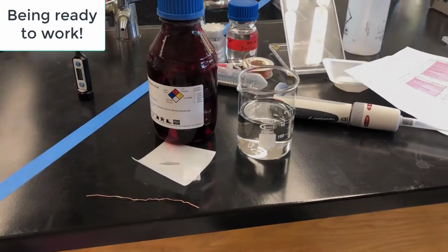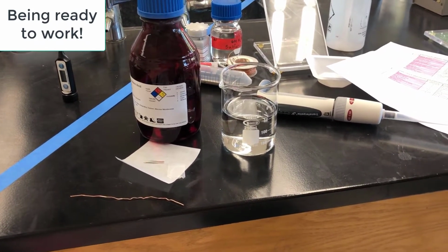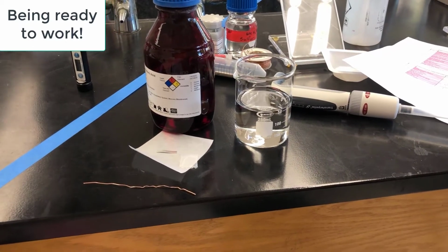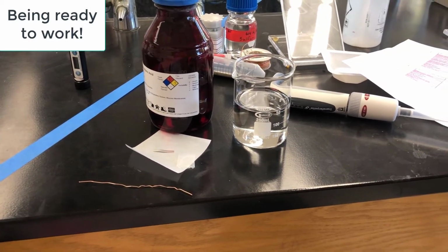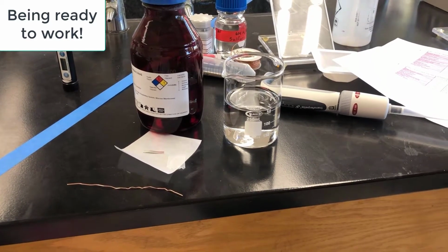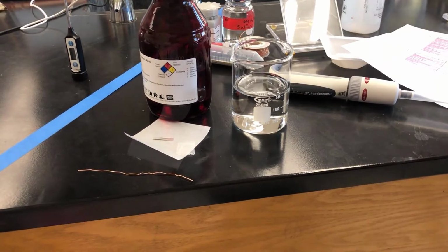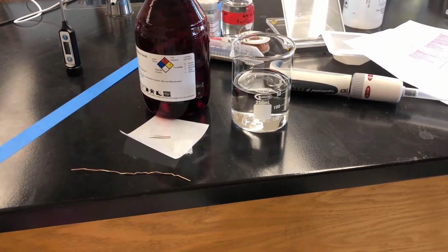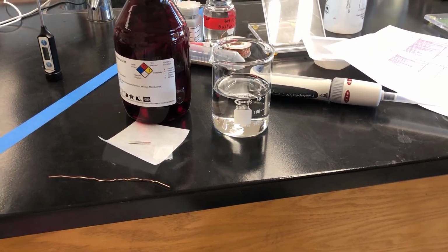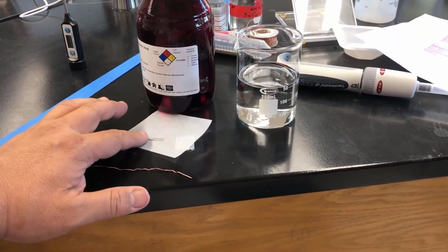I have all the things laid out for what I'll be doing in this next step, and I thought I'd just say something about this. If you want to be efficient in a laboratory or any workspace really, it's important to read the instructions of what you're doing and make sure that you have everything prepared ahead of time. I am actually modifying the procedure a little bit from the original procedure, but I think I'll rewrite it for you guys. There's the magnesium strip.